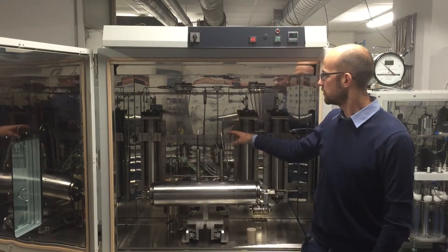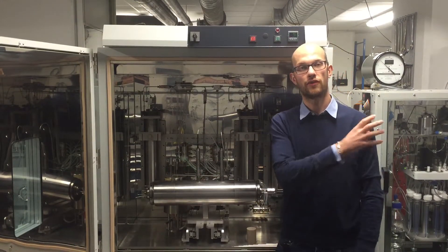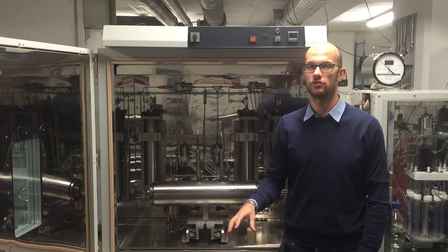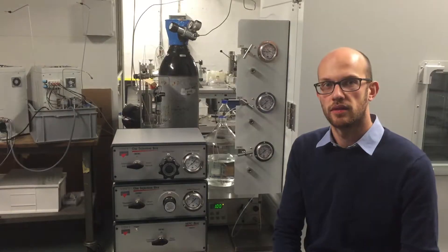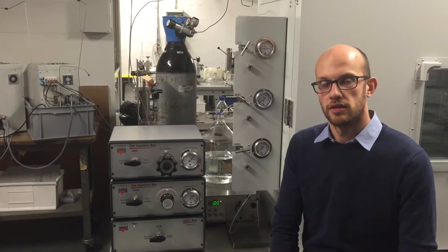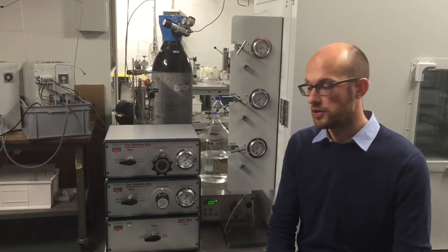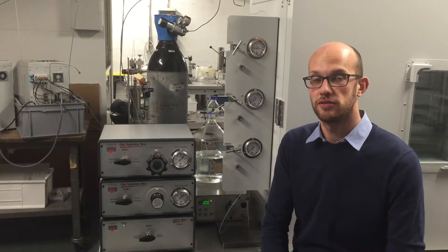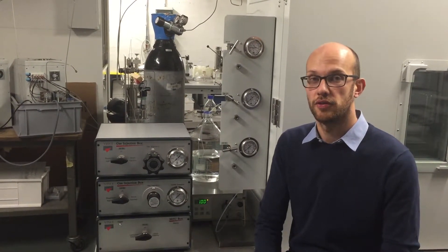In the oven, we also have directional valves that allow the user from the software to choose which process fluid is going to be injected inside the system. In order to inject water to the steam generator, we use this HPLC pump here. It provides constant flow rates to the steam generator and so generates vapor for the core holder.